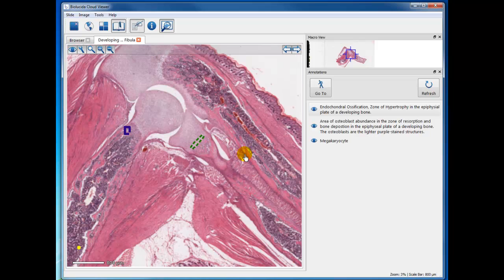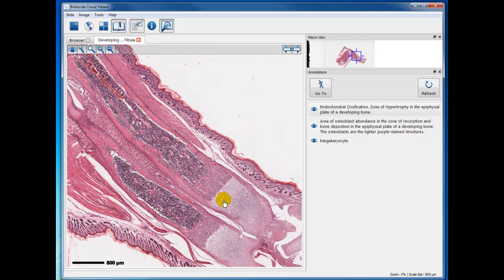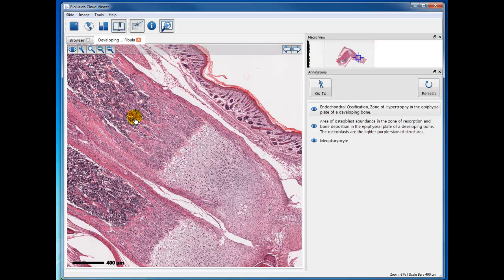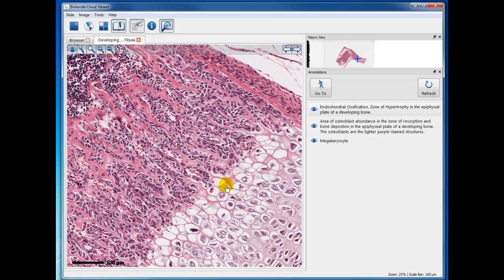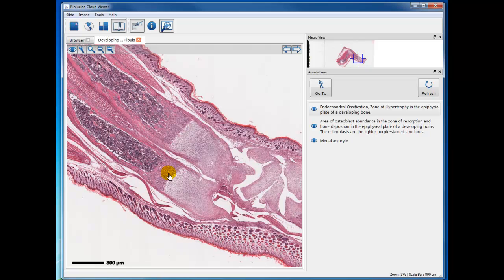Okay, I think that's about all that I need to point out in this specimen. I guess there's still another area down here you can study the same phenomena. From about here to here would be the epiphyseal plate. In fact, this is quite good, showing the different zones. So good luck in your study of this specimen and learning about endochondral bone tissue.